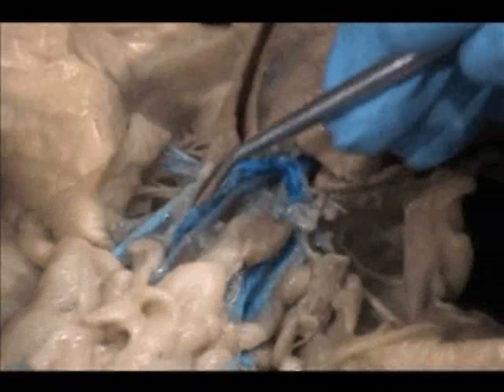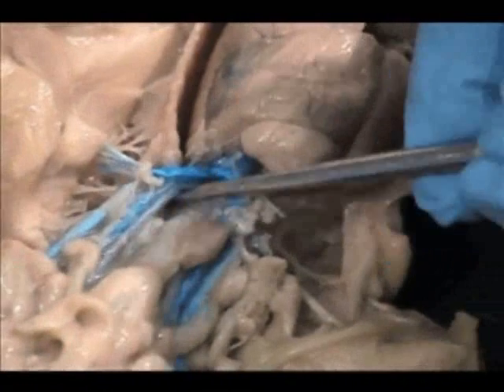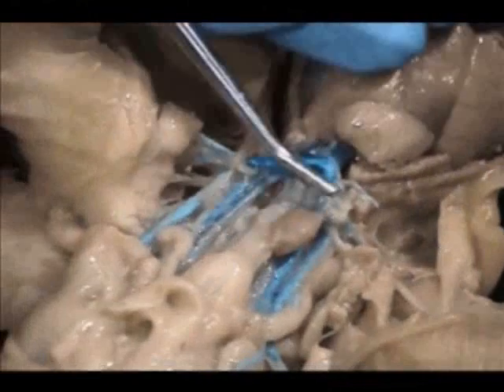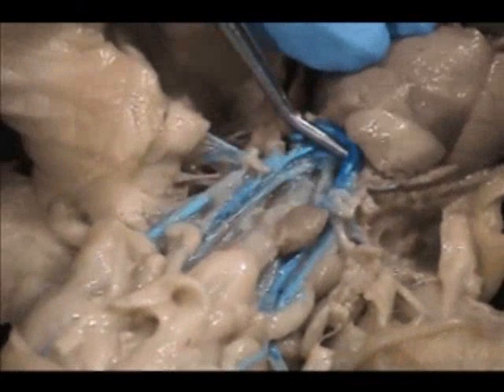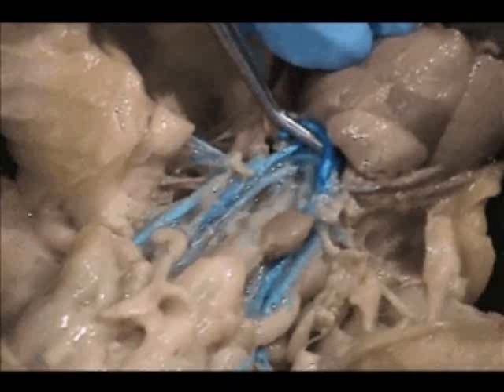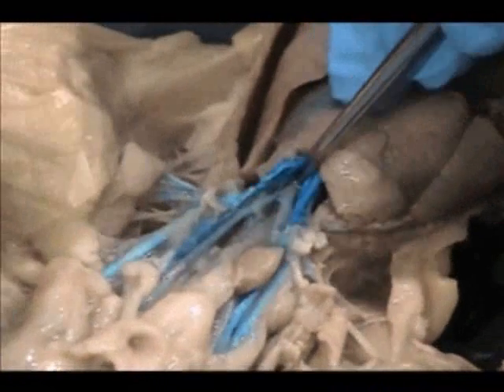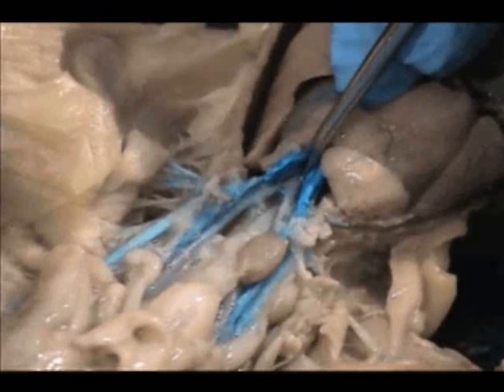Your goal is to follow your left and right common carotid arteries down to where they actually meet, and to do so without too much destruction — follow those common carotid arteries down to where they meet or branch off of a main trunk, which you might be able to appreciate from that view.